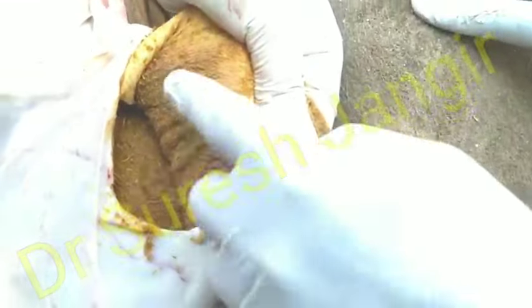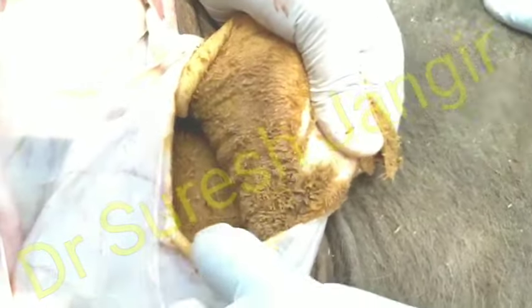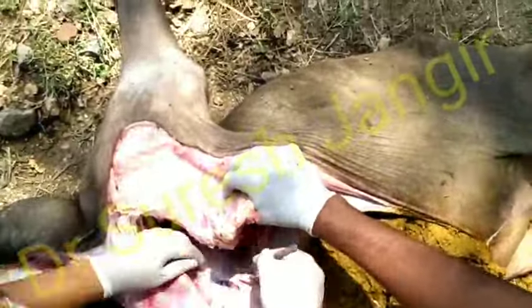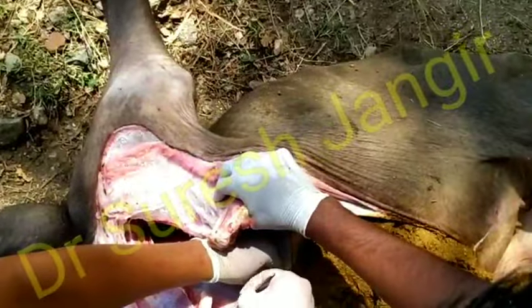After that, we should go for examination of the thoracic cavity. The lungs are normal; no abnormality detected. After examination of the lungs, we should open its heart — the main part of the carcass for determining the actual reason of death.